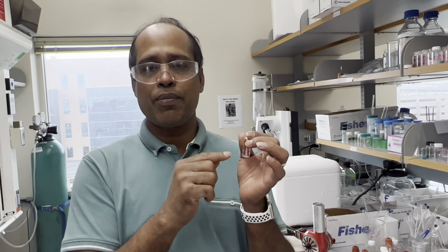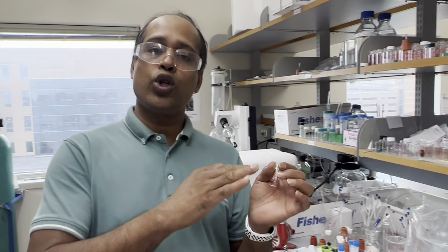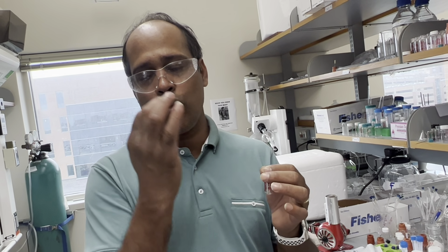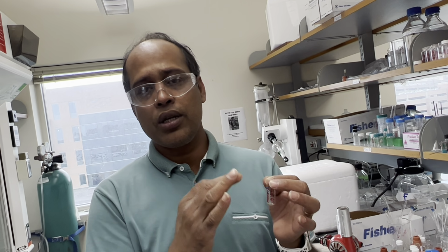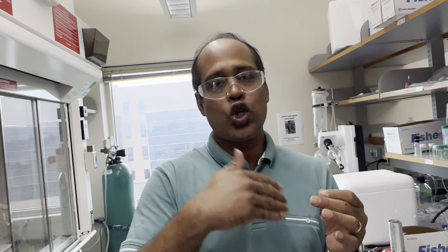That's why we need to adjust the pH while we are adding the DMSO. So we are not using the total 490 microliters of DMSO at a time. Initially we will use some amount, and then we will add 5 microliters, 10 microliters of 1 molar HCl solution. Then we'll check the pH, and once it is acidic, we will top up the remaining volume.